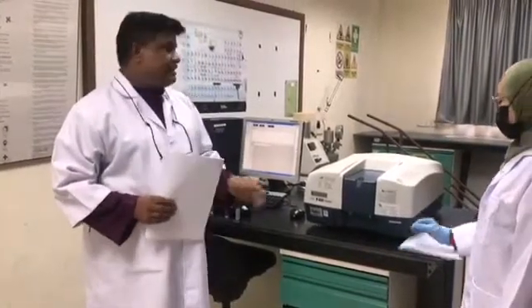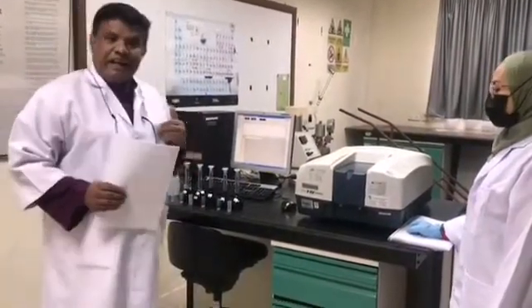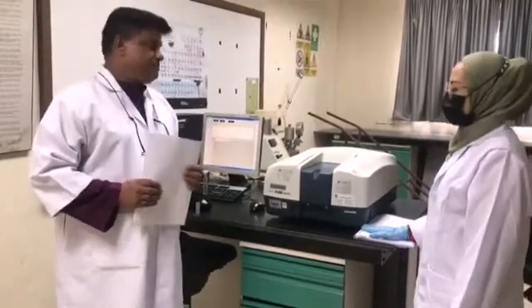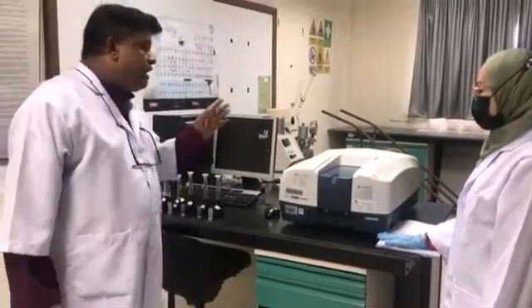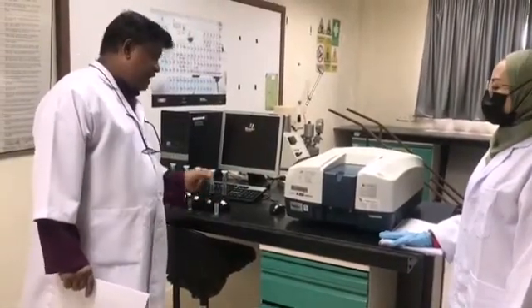What is a UV-Vis spectrometer? This is actually a very well-known analytical instrument. By using this, we can determine the unknown concentration of a substance in solvent. UV-Vis refers to the quantitative measurement of the reflection or transmission properties of the ultraviolet-visible spectral region. Using this instrument, we can determine the amount of ultraviolet and visible light which has been absorbed by a substance in solvent.